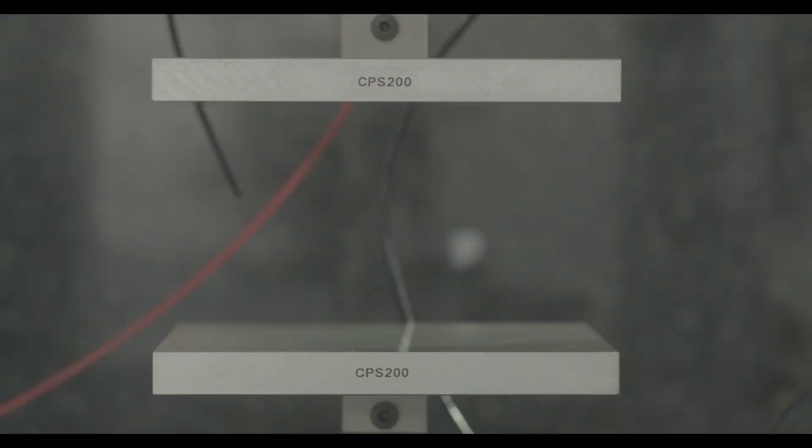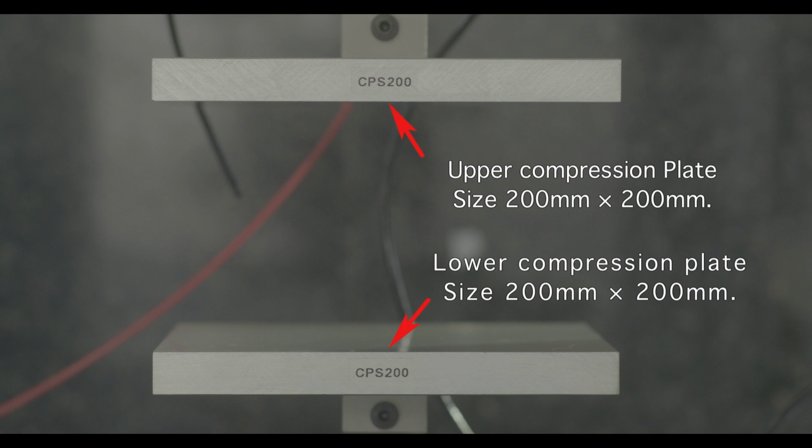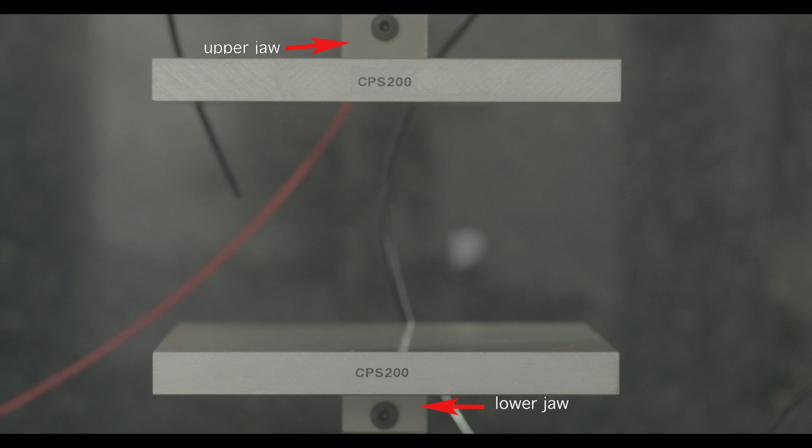The tensile testing machine is CRE principle based and is provided with the following arrangements. One upper compression plate and one lower compression plate are provided for compression testing. The size of both compression plates is 200 mm by 200 mm. The lower compression plate is attached to the lower fixed jaw and the upper compression plate is attached to the upper movable jaw of the instrument.